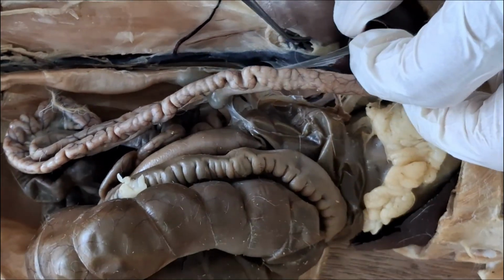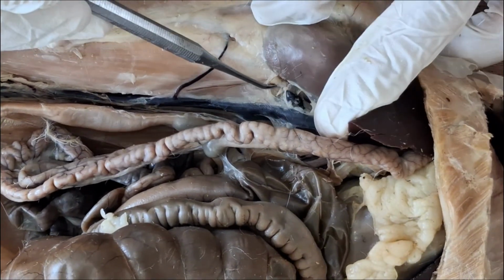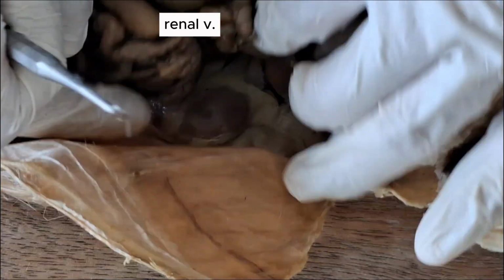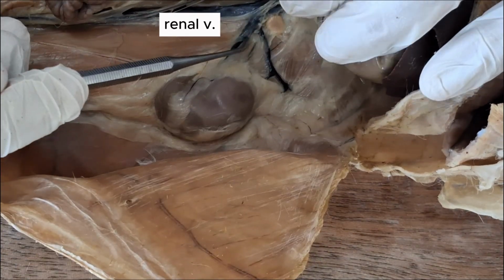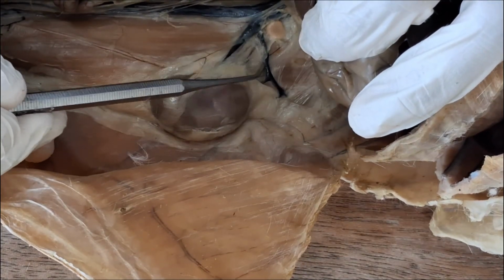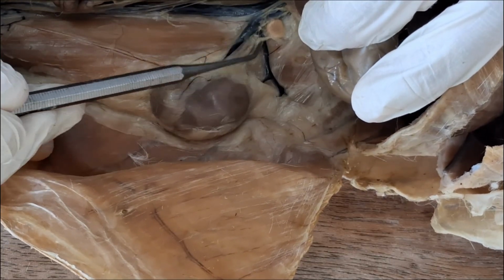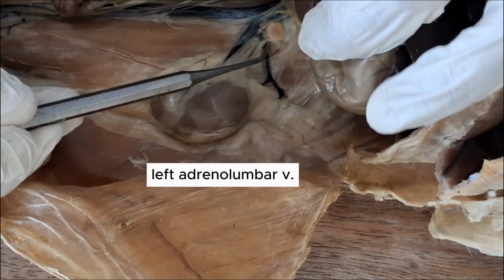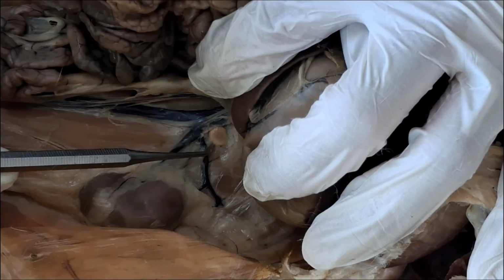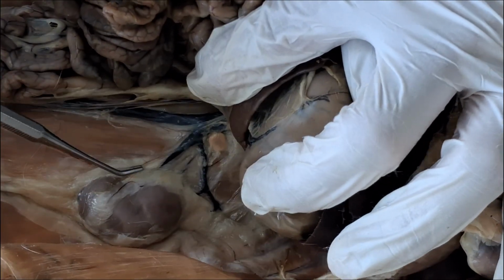starting from the cranial end. So there's a pair of renal veins going from the kidneys. This is the right renal vein, left renal vein. You can see that there's another tributary, there's another vein slightly cranial to the renal vein. This is the adrenolumbar vein. It's right next to this little organ here called the adrenal gland. Adrenolumbar, renal.